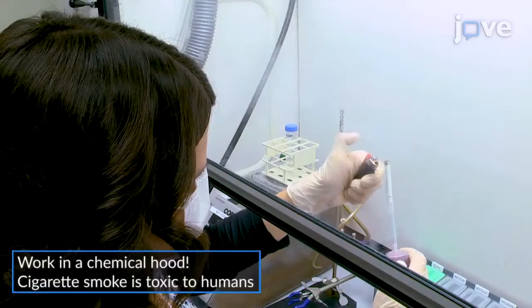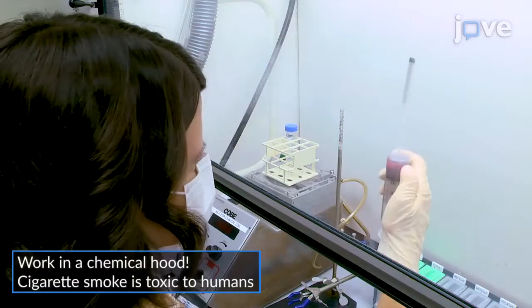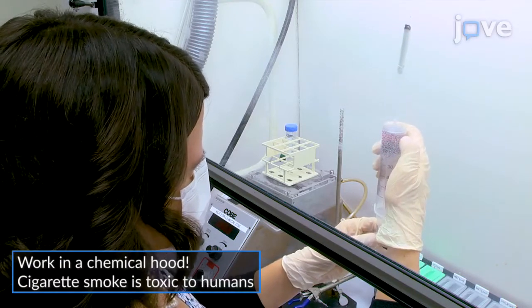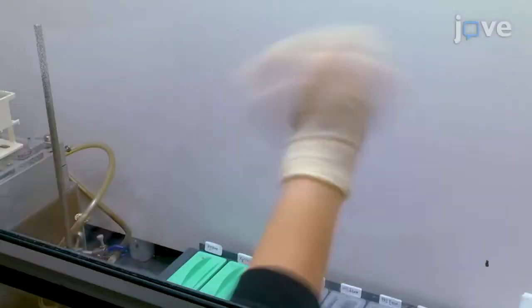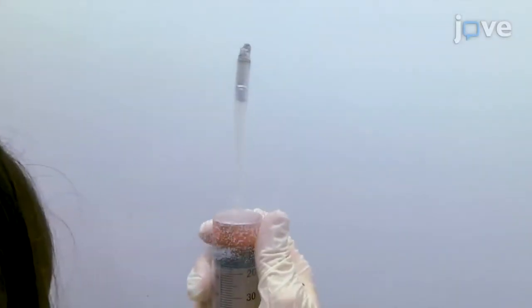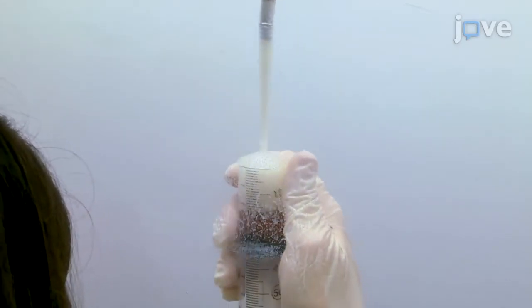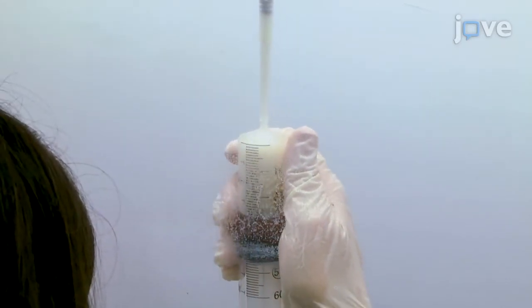No more than 30 minutes before performing the assay, combust the cigarette and draw 40 mL of smoke-containing air into the syringe. Mix the smoke with the medium by shaking the syringe vigorously. Repeat the drawing process until the cigarette is completely burned out, which will require about 11 draws in approximately 7 minutes.